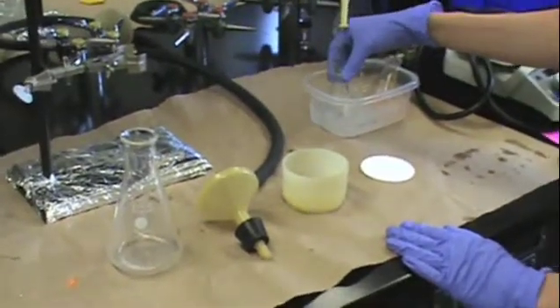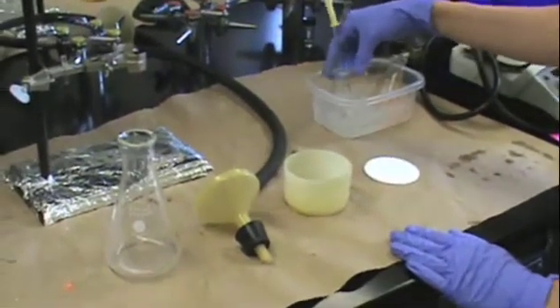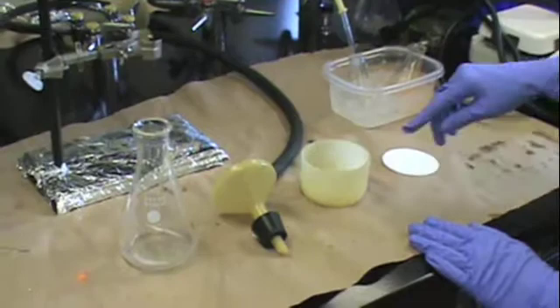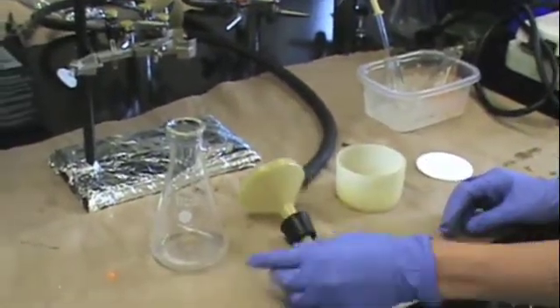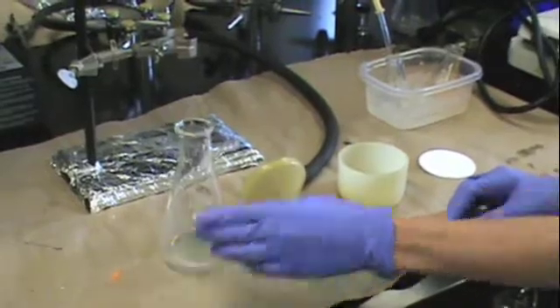You will need your crystals, some solvent that you're keeping on ice, a piece of filter paper, the top of your funnel, the bottom of your funnel with a stopper, and a sidearm flask.